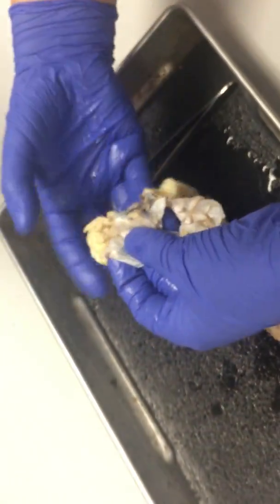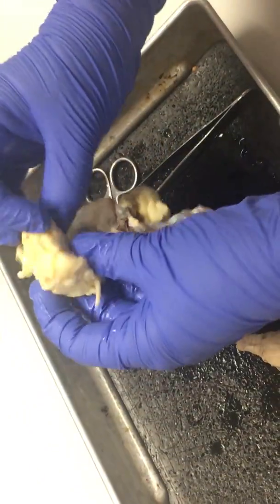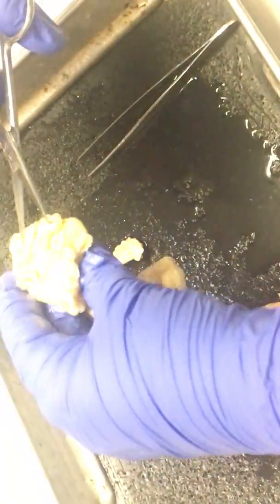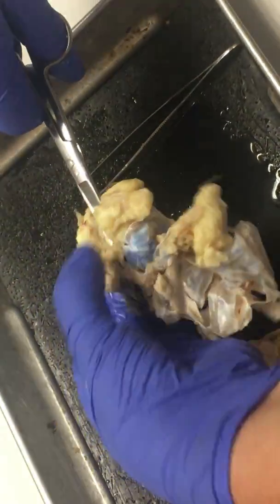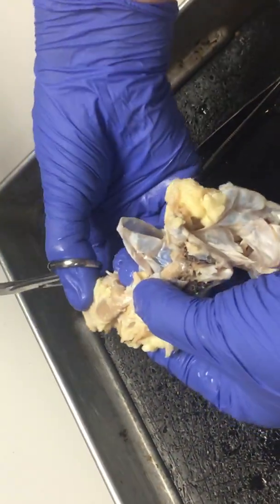Let's look at the optic nerve. There's the end of the optic nerve — this is where the eyeball would have gone. I can cut through this fat, and when we dissect eyeballs, you are going to have to cut a lot of fat away to get to both the optic nerve and the eyeball itself. You can actually see the eye muscles here. See that dark stuff? That's an eye muscle.